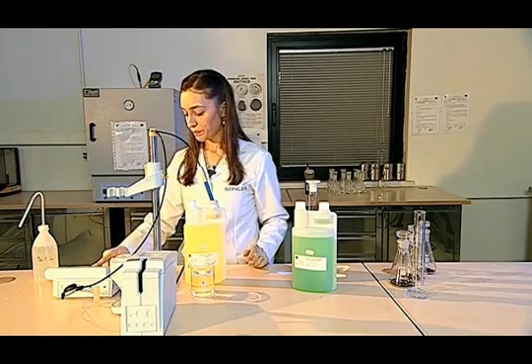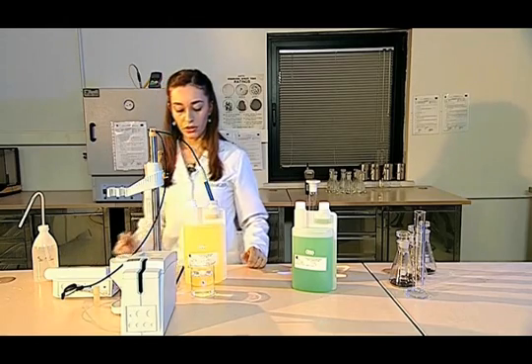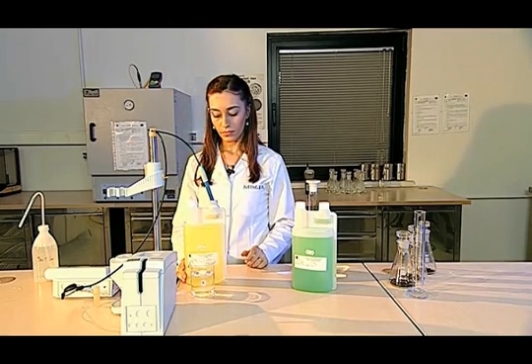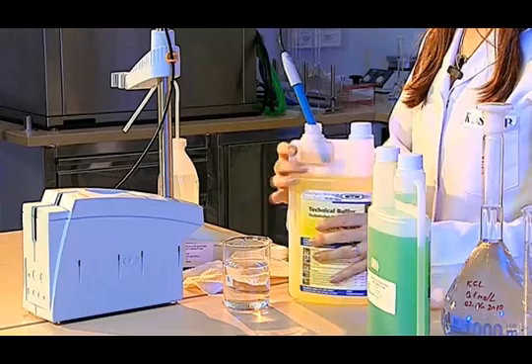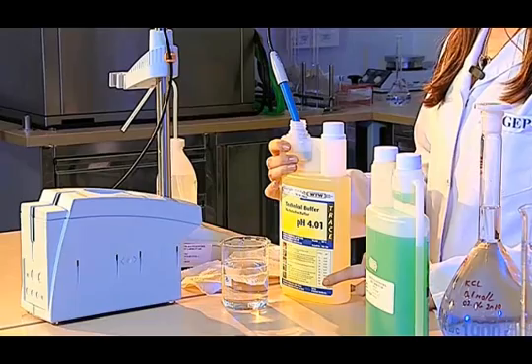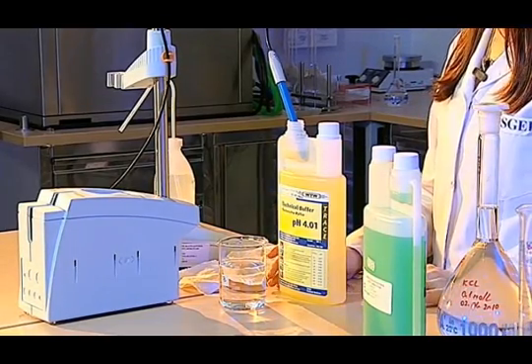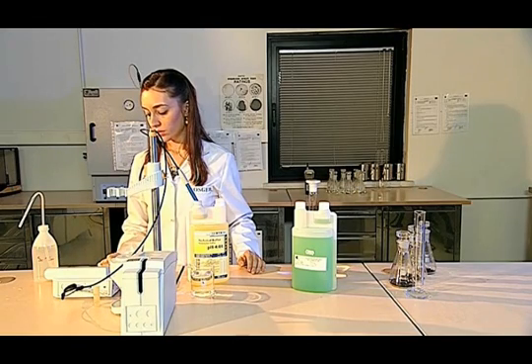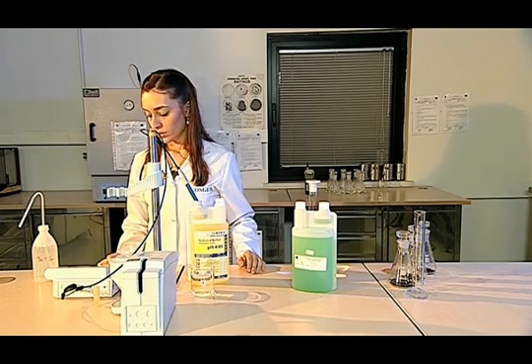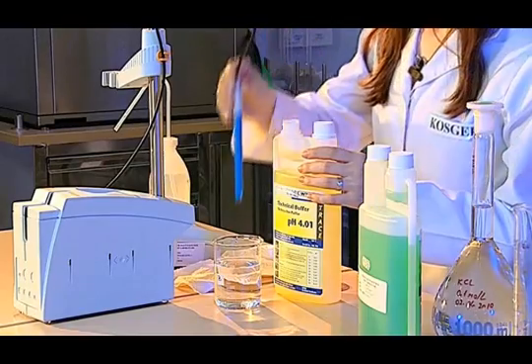After the completion of this process, I measure the pH of the buffer. If the value of the pH 4 fits with the temperature on it, then I understand that the pH is correct. After observing this on the screen of the pH meter, the calibration with the pH 4 process is completed.